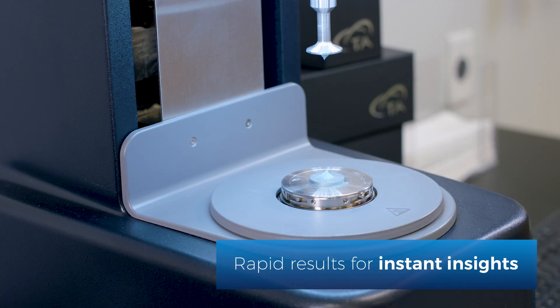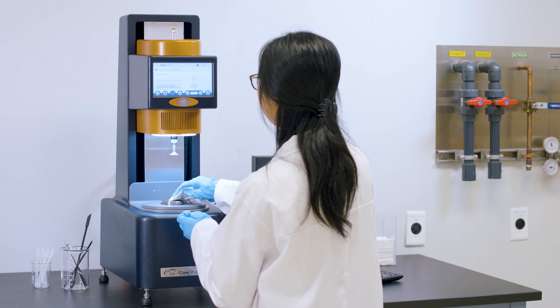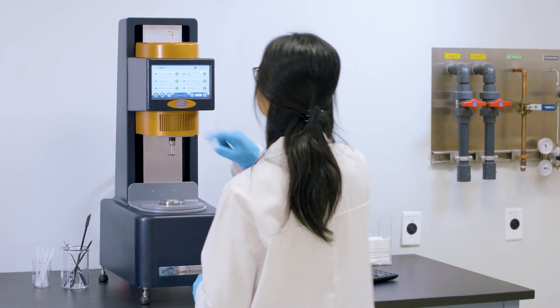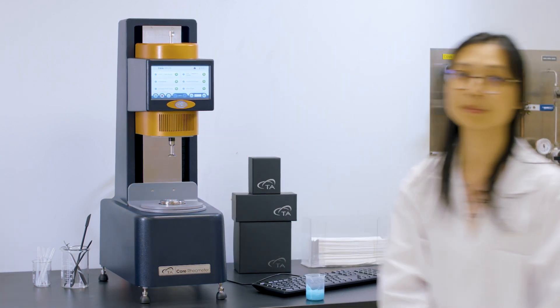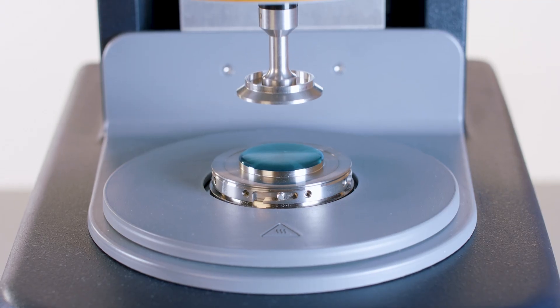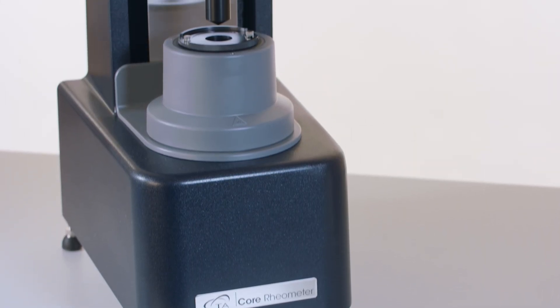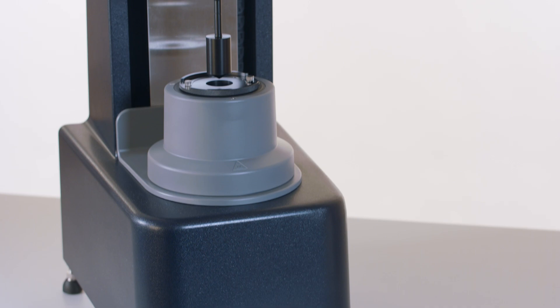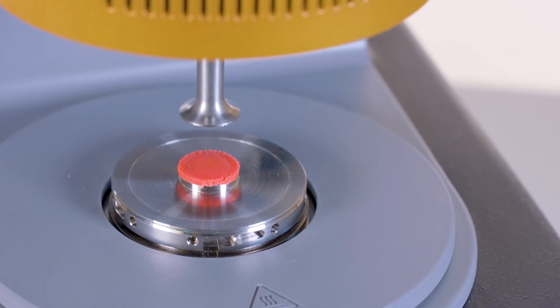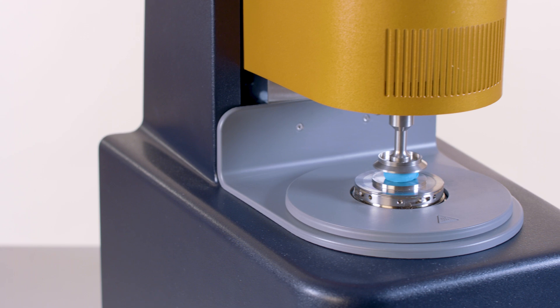Users of all experience levels are now empowered to measure key viscoelastic material properties, bringing valuable data into laboratory workflows. From syrup to slurries, the Discovery Core Rheometer guides every step to deliver dependable data. Stop settling for less information.